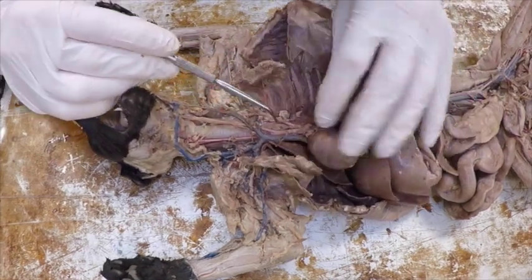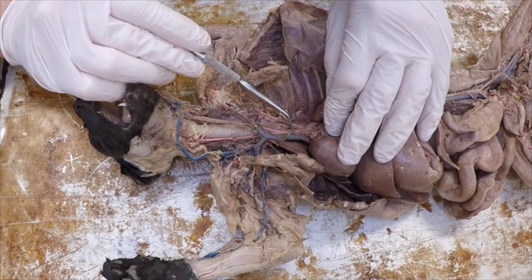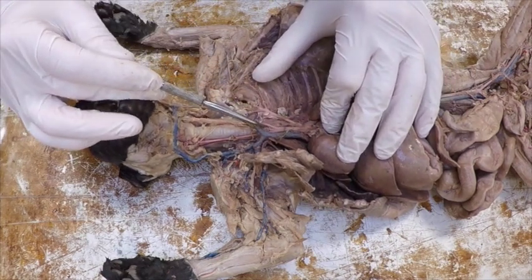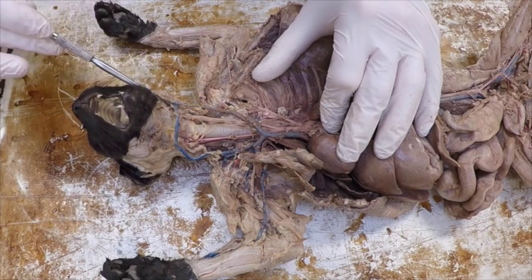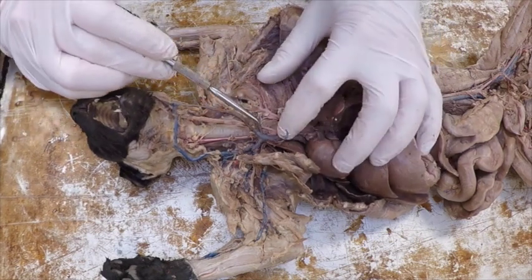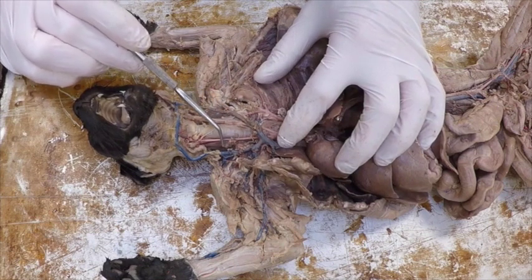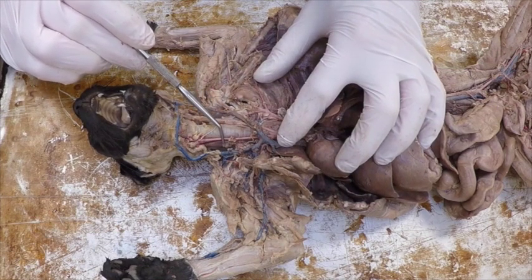If I follow up and I go along with the brachiocephalic and I follow the brachiocephalic on up, it's going to split into the left common carotid, which comes all the way up along the neck, and it has a right common carotid, which is tucked underneath these veins, so it's kind of hard to find and see. I got to clean them up. There's my right common carotid.